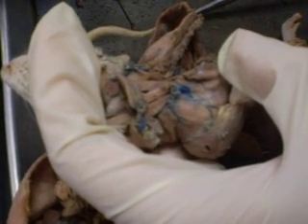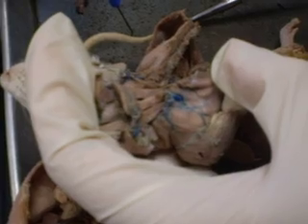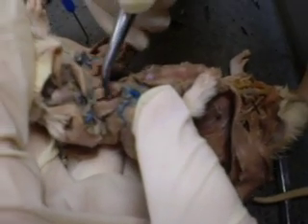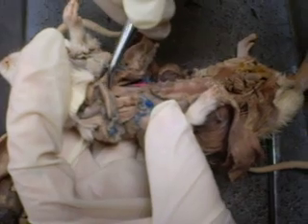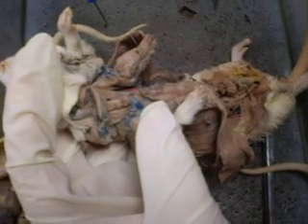So based on logical thinking, which do you think comes most external? Cleidocervicalis or cleidomastoid? Cleidocervicalis. Exactly, because cervicalis is your shoulder. So the most external one right here, cleidocervicalis. That only leaves the next one, cleidomastoid. Sternohyoid, you know by virtue of it being the first one covering the trachea. So you have two muscles left, which is the sternomastoid and your omohyoid.